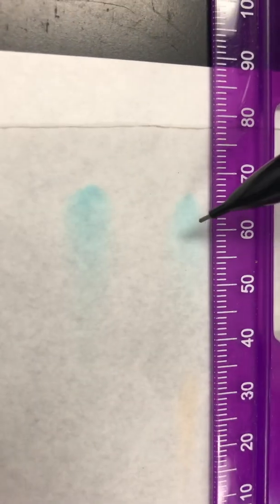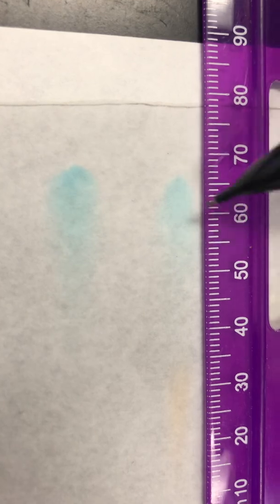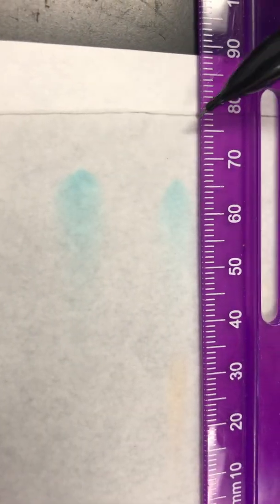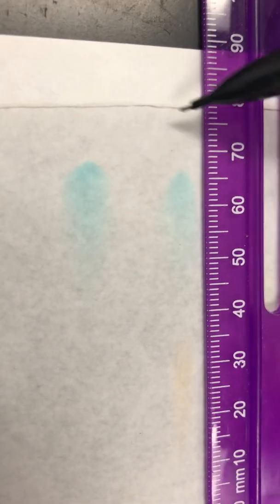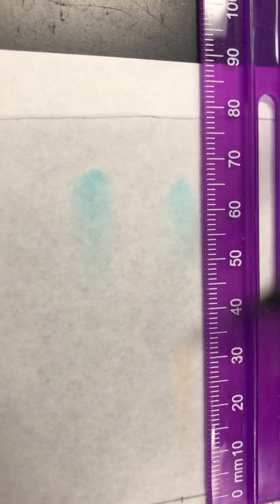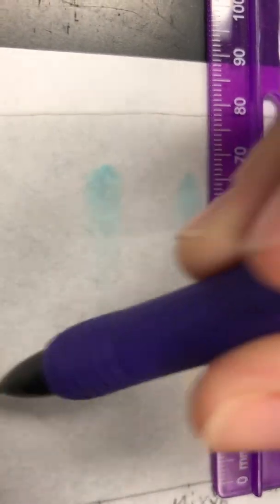Now we're going to measure the blue, your B1, and your D solvent should be the same. Because it's in the mix, your D solvent for both of the mixes should be the same answer, but your two D spots are going to be different. And you're going to compare them to the ones that we used before in the mix.